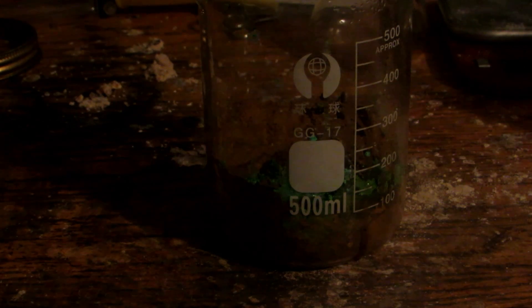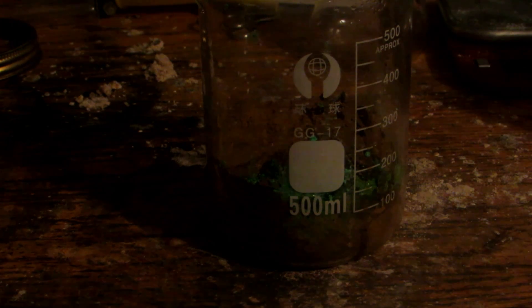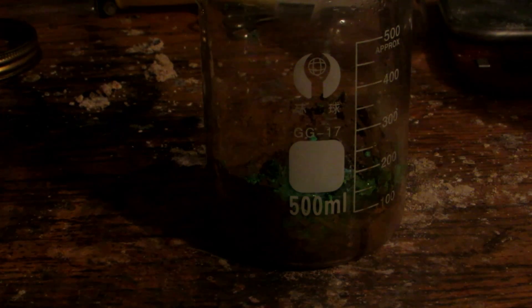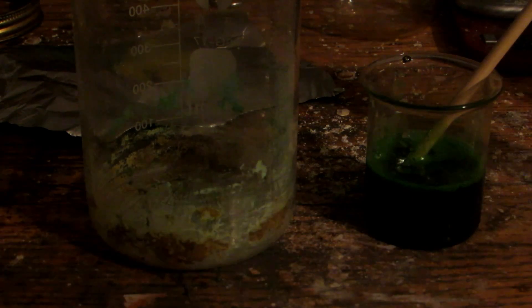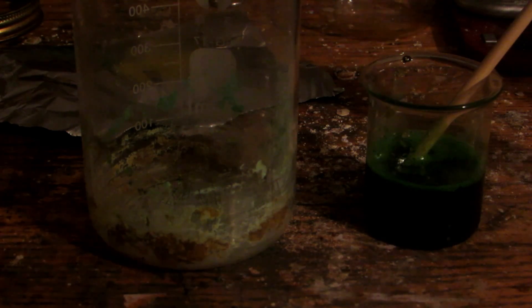What we can do now is add a bit of water to get a slurry, break everything up, and rehydrate all of that anhydrous copper chloride. Then we can re-dry it by letting it evaporate and we'll be left with nice green copper chloride, perfect for the reaction. I'll add about 25 to 50 milliliters of water to rehydrate everything. I'll take the dissolved solution, put it in a smaller beaker, place it in the oven at really low heat, and just evaporate off the water to get nice crystals of the hydrated form of copper chloride.